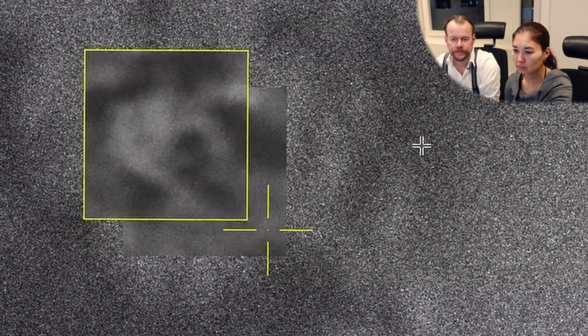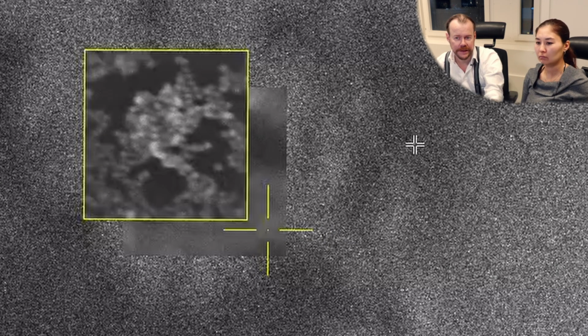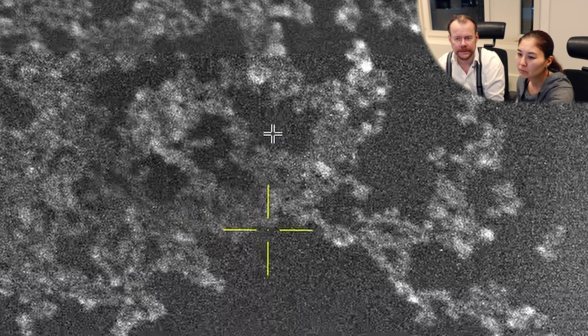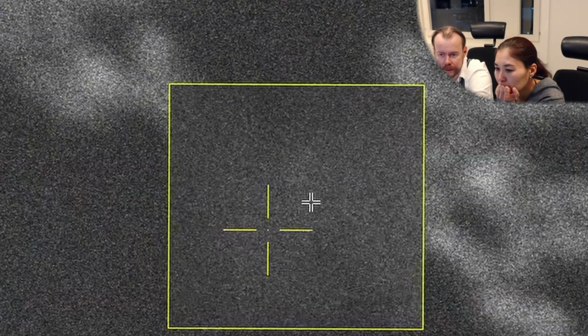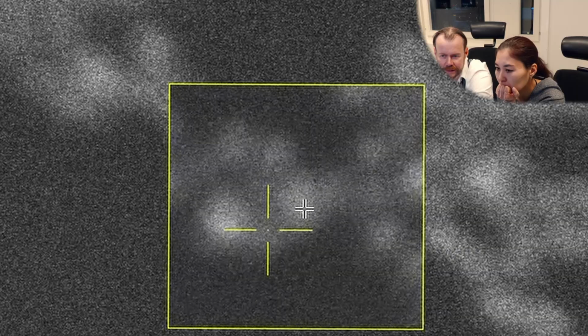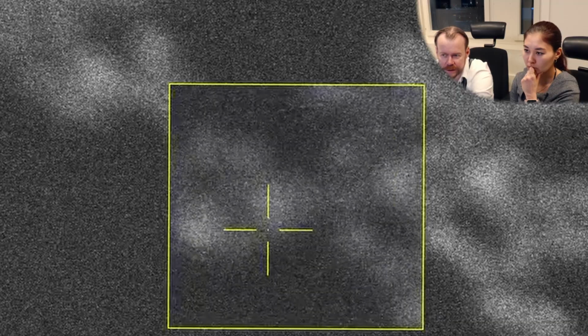Astigmatism, you correct on the board, make the image sharp. Try up and down. Good. Try left and right again. Yeah. All right. So now we can zoom in even more. You see, line still comes, right? We can also check the column centering.